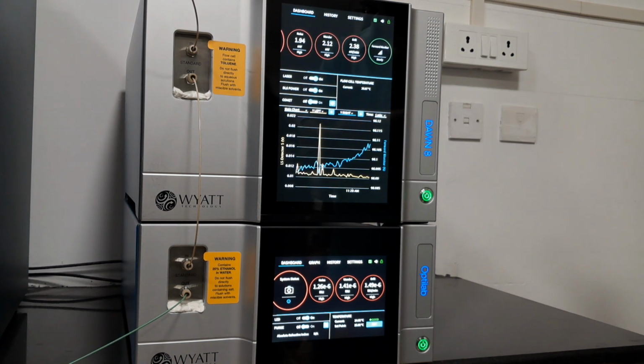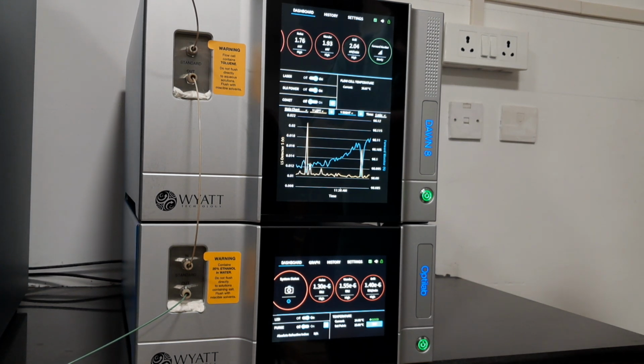But I am telling that depending on my mobile phase, the flow rate used is suggested at 0.5 based on the BSA. Yes, for the BSA it is 0.5. For my sample it might be different. How to optimize that, we have to see. That application part we have to take on ourselves.